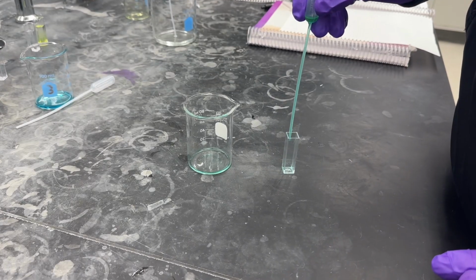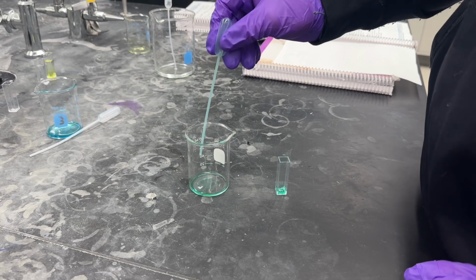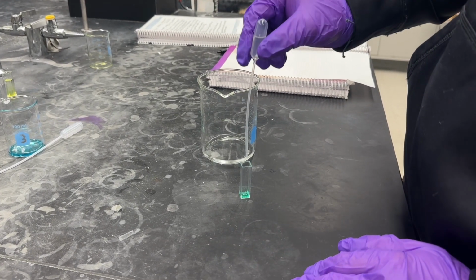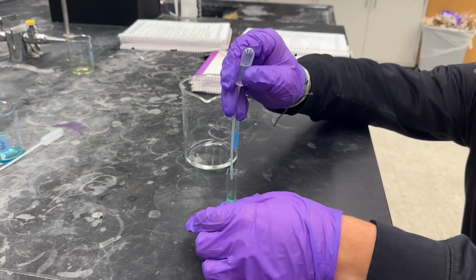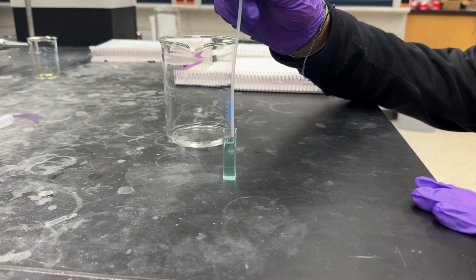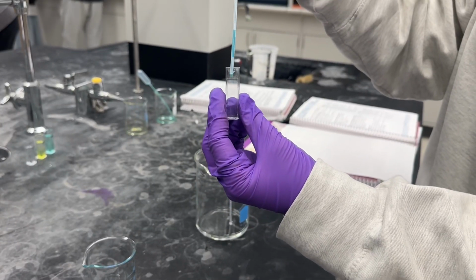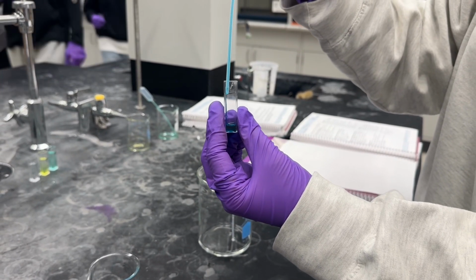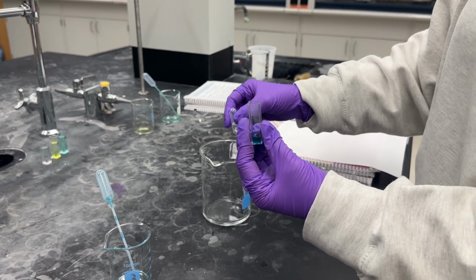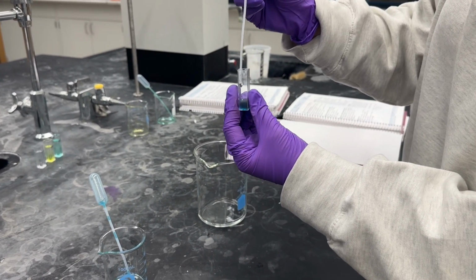Once you have all 4 cuvettes, you're going to go to the spectrophotometer room to collect a UV visible spectrum that scans through each sample of your color collected. Now, once you get to your station, you will use the cuvettes with the colored solution along with the blank. The reason we scan across 800 to 200 nanometers, which you will see later, is because we want to scan all possible wavelengths to find the one with the maximum absorption value.